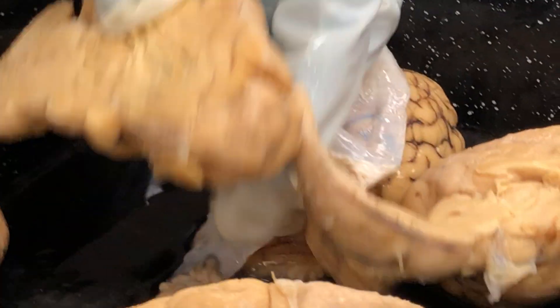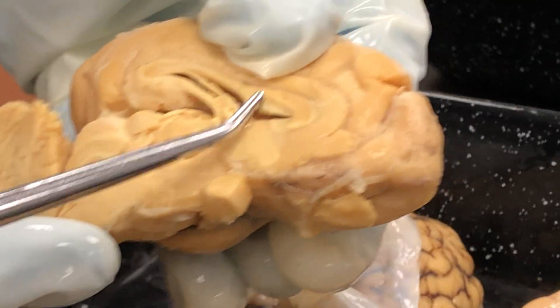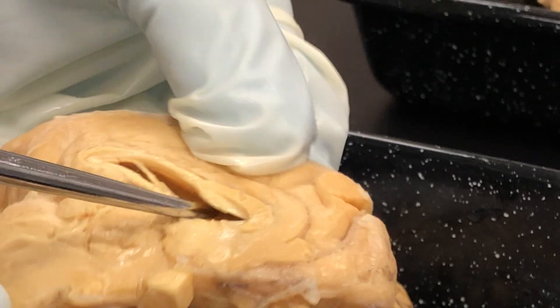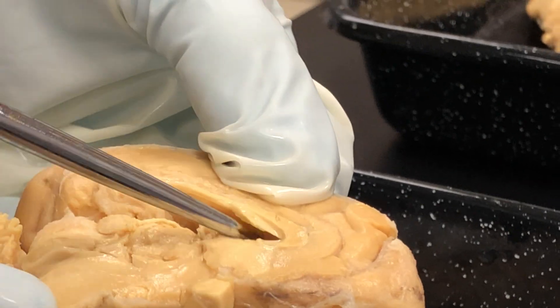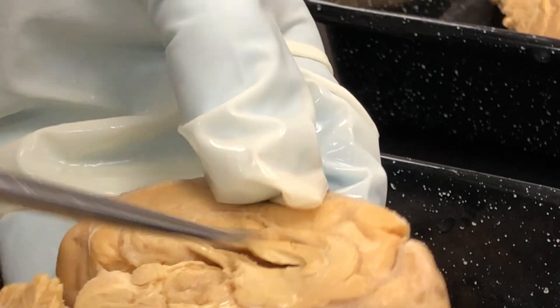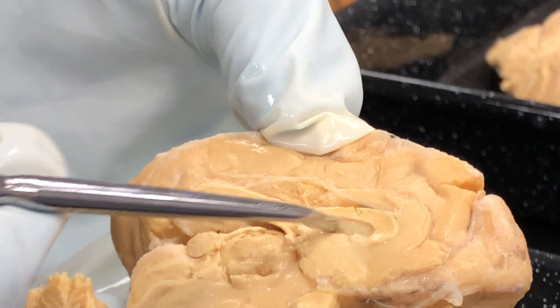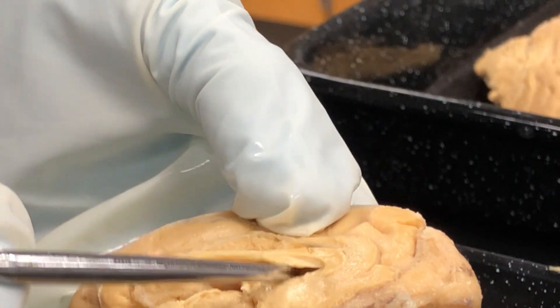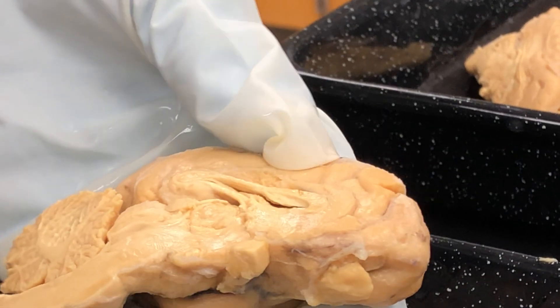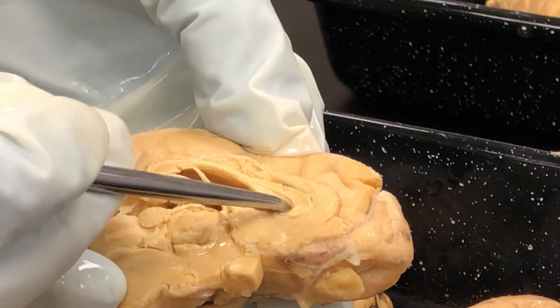This is the septum pellucidum — the thin wall of tissue that separates the lateral ventricles. If you go inside and flip the septum pellucidum back, you can see into one of the lateral ventricles. So that is a lateral ventricle, and the septum pellucidum is this thin wall of tissue that separates the two lateral ventricles. The lateral ventricles are the space inside there.